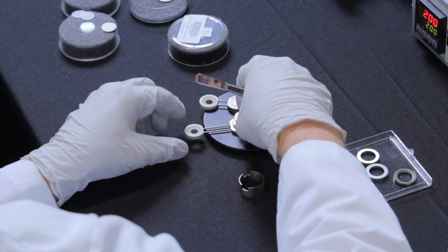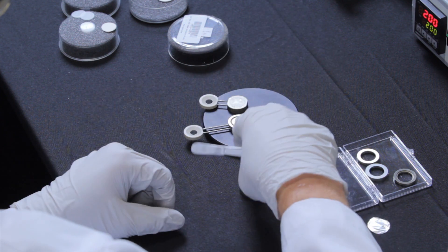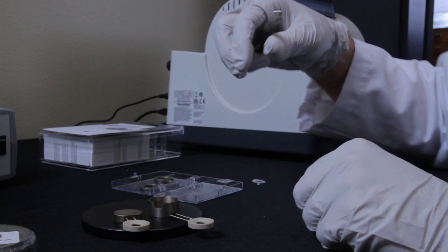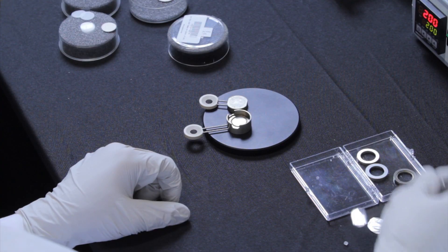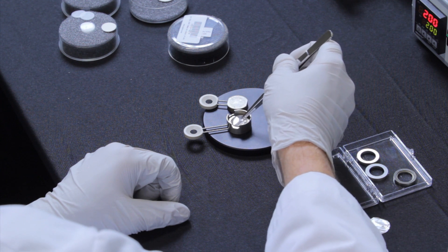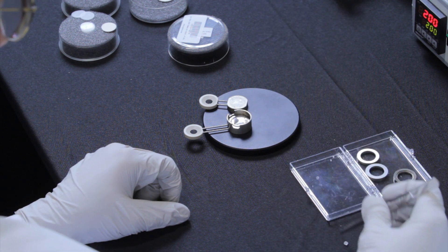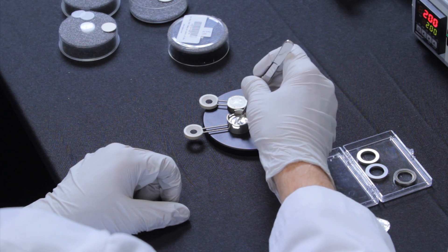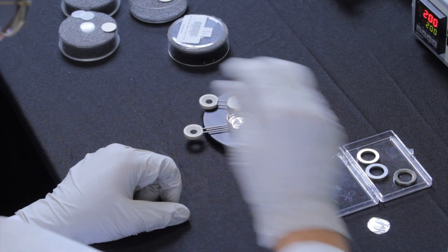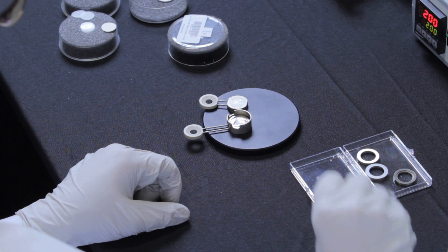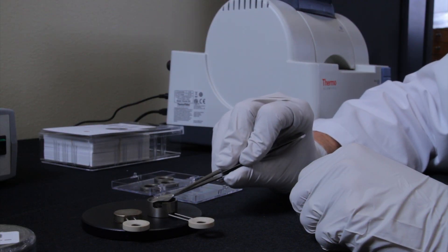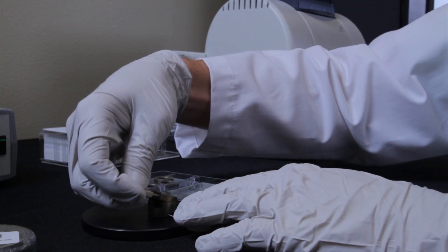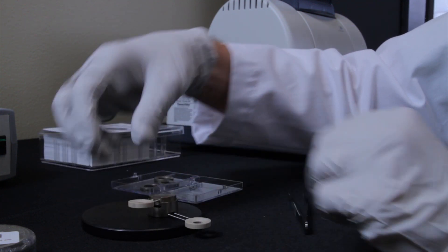The first thing you do is put the ring on the platen and then assemble the collar over the ring. Then you can take a small foil, place it on top of the platen followed by your sample polymer pellet. Next a larger foil will go on top of the polymer pellet and then you'll place the top platen on top of the entire assembly.